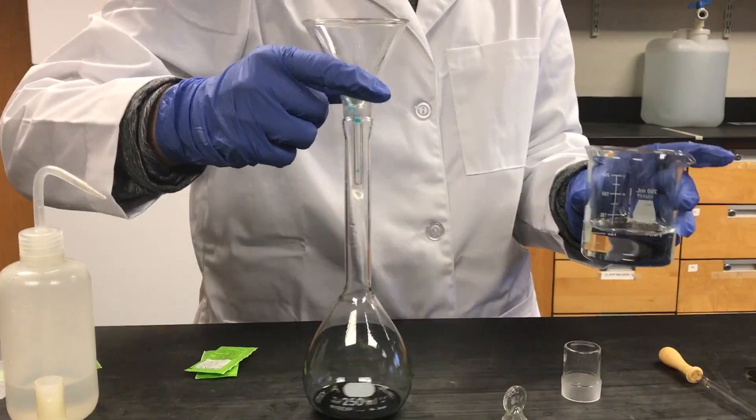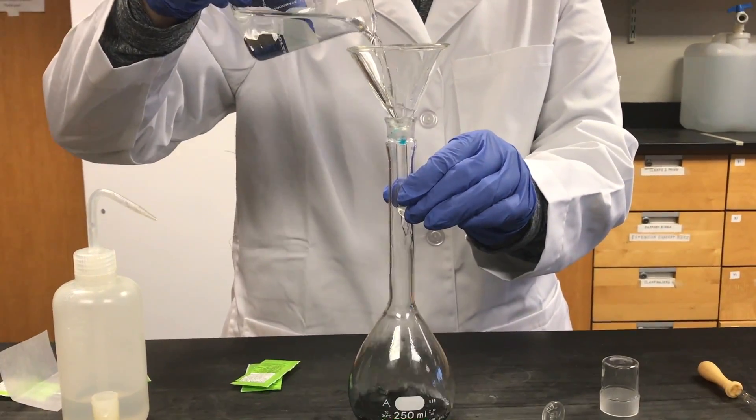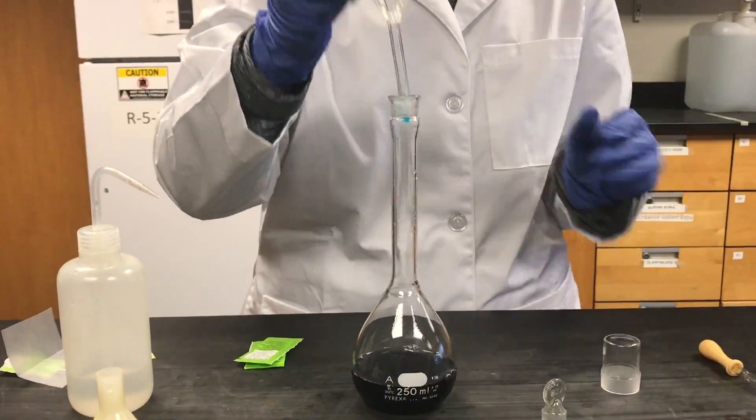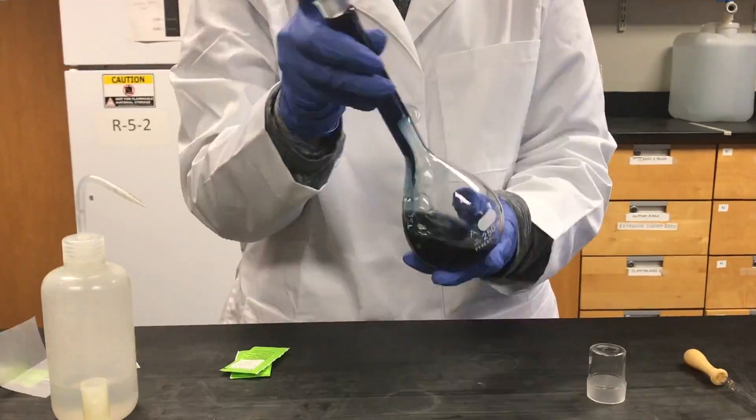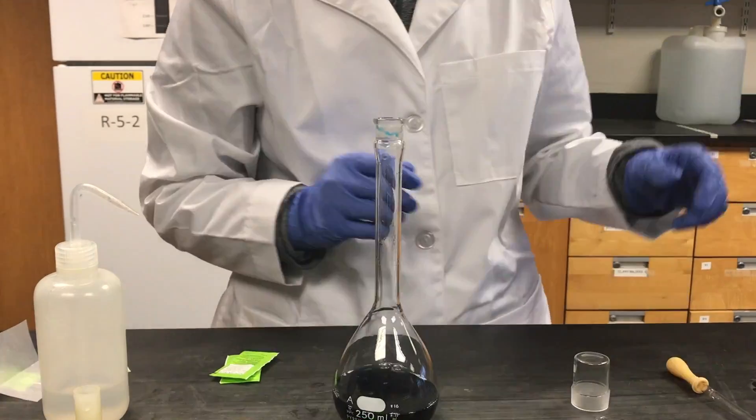To mix the solution, you must fill the volumetric flask up halfway with DI water. And then make sure the cap is on tightly and mix 20 to 25 times.